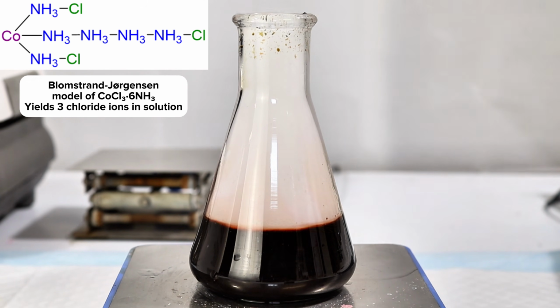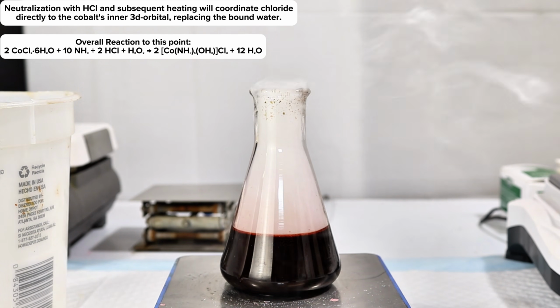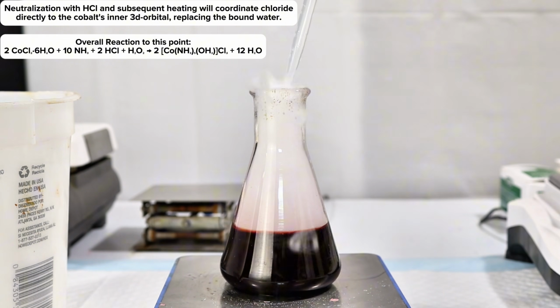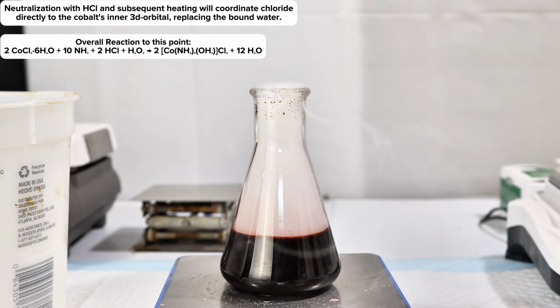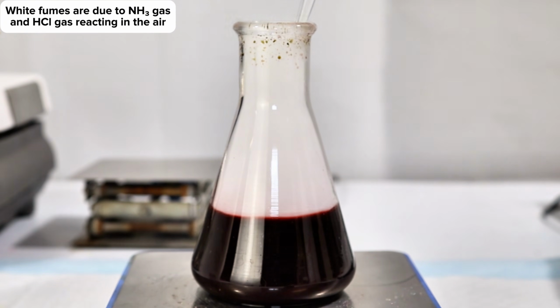However, by neutralizing the excess ammonia using hydrochloric acid and heating, you can force the coordination of a chloride ion to the inner 3d orbital in place of the water molecule, rather than having all 3 chloride ions bound to the outer 4d orbital. To do this, I simply added 37% hydrochloric acid in small additions until the resulting solution was strongly acidic. This will produce a large volume of white fumes, which is due to ammonia gas and hydrogen chloride gas reacting in the air to form ammonium chloride.